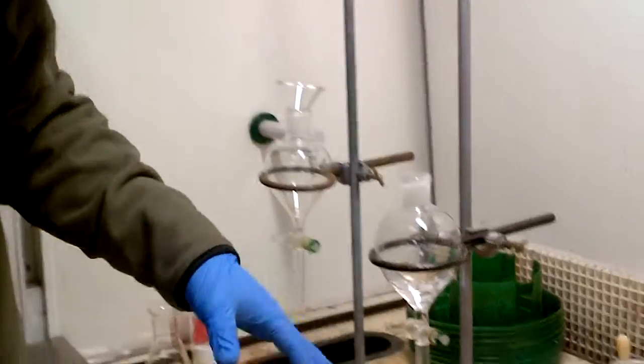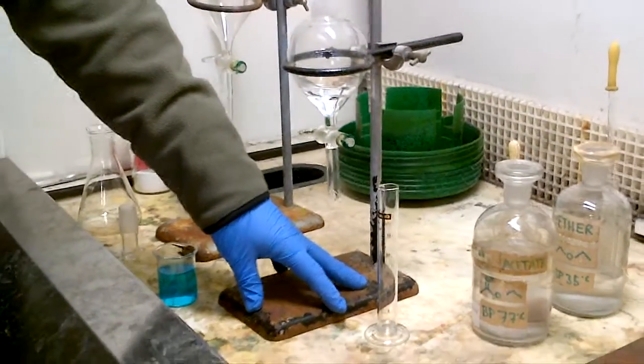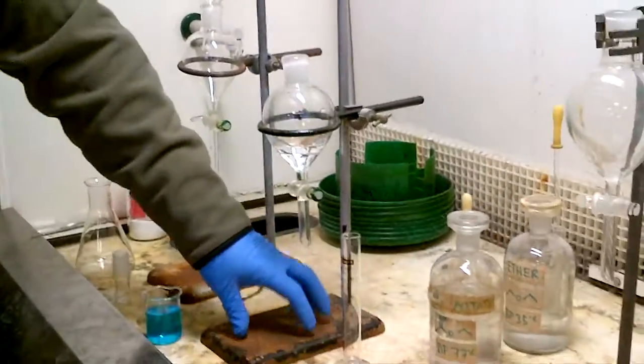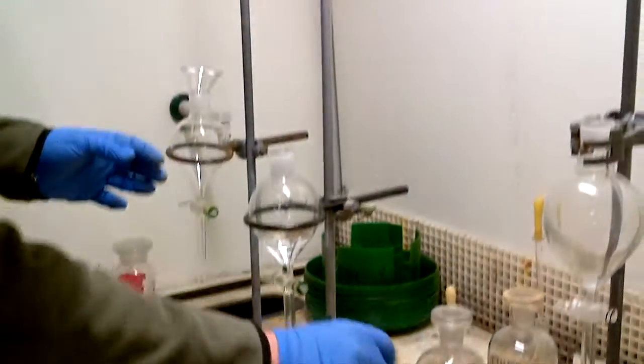Anything else, if you're clamping glassware onto a stand, make sure that the stand is secure and the glassware is in the centre of the weight on the stand. So that's a good position for clamping.